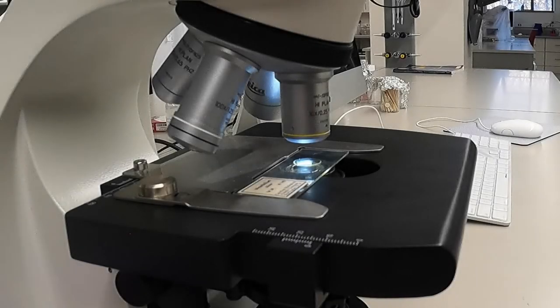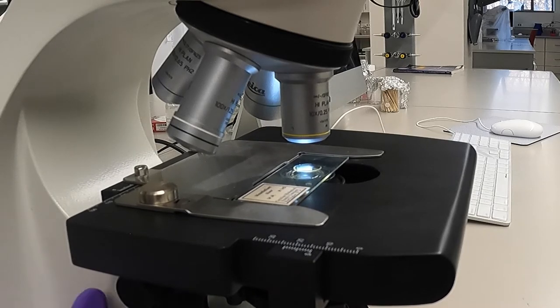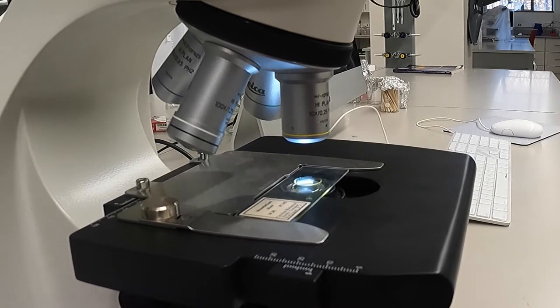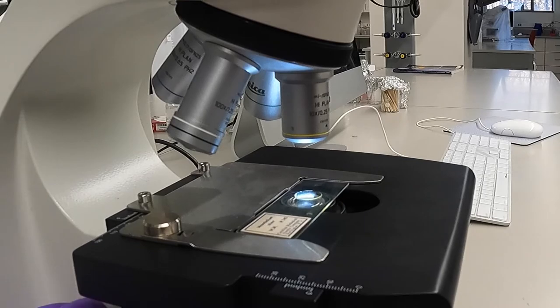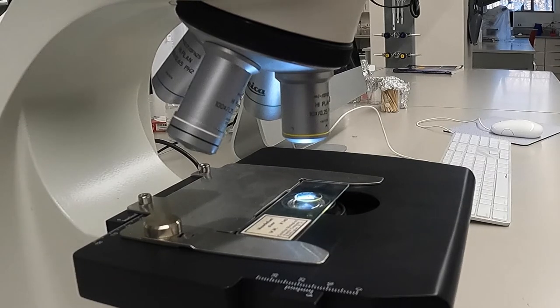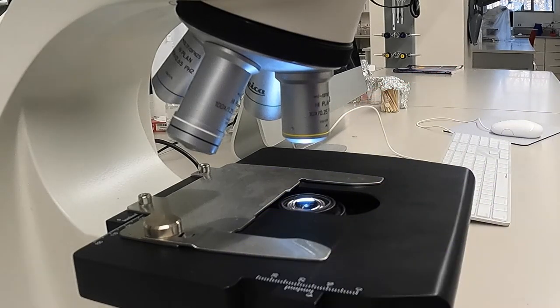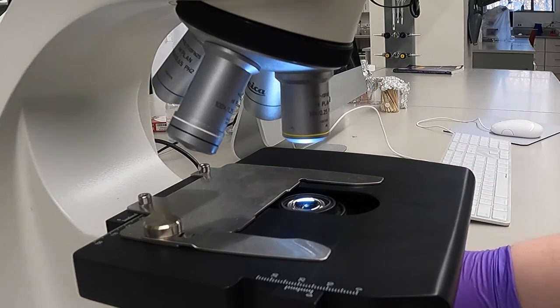When you are done with the microscope for the day, go through the following steps. First, lower the stage. Then, switch to the 10x or lowest powered objective. Finally, remove your slide, power off the microscope, and replace its cover.